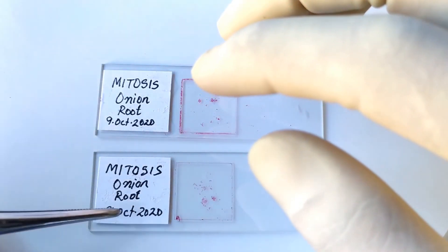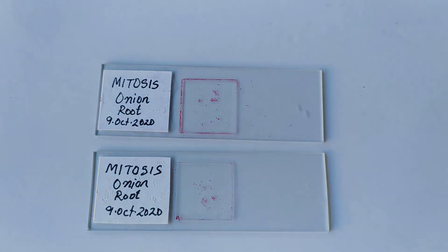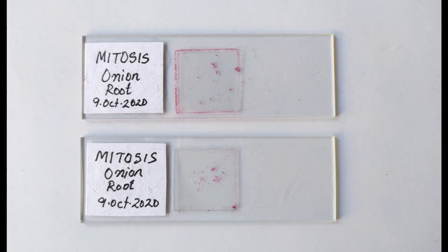You now have two prepared permanent slides made from a single temporary slide preparation that are now ready to go under the microscope.